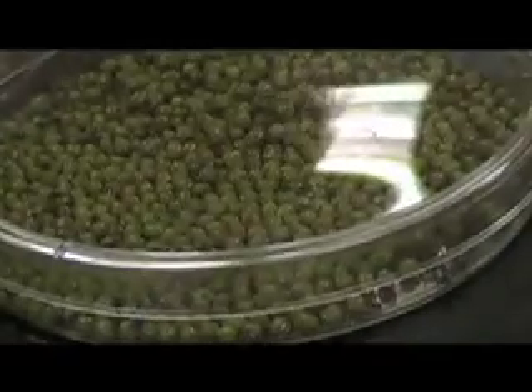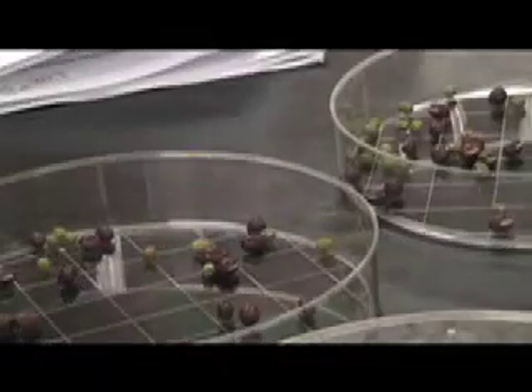Do they need to be separated? No. So we need to see what they put further. Are we doing this at the bottom line? Yeah. Do they fly? They don't really fly, but they can escape. We don't want anything to escape. I told you that there are pests in Africa and Asia, so we don't want our bean beetles to escape and destroy our stockpiles of beans in our country. Don't let any bean beetles escape.